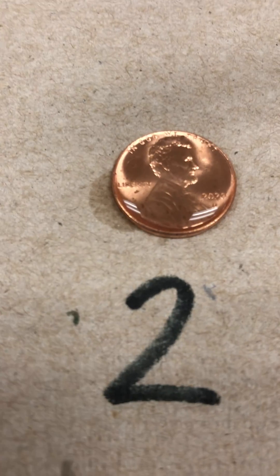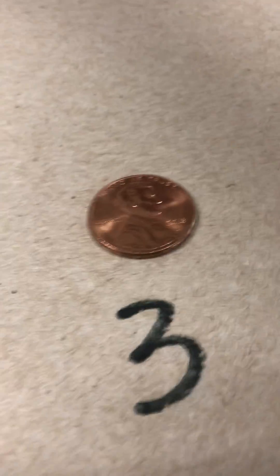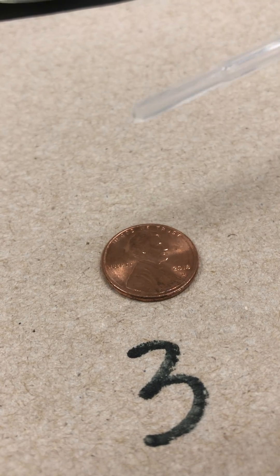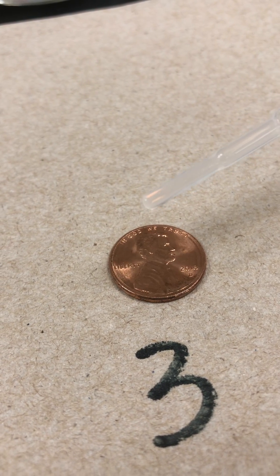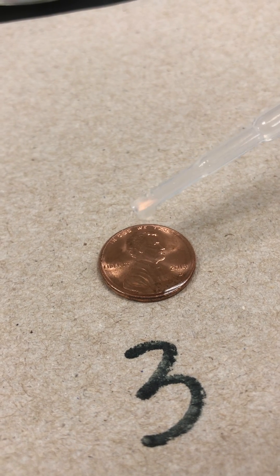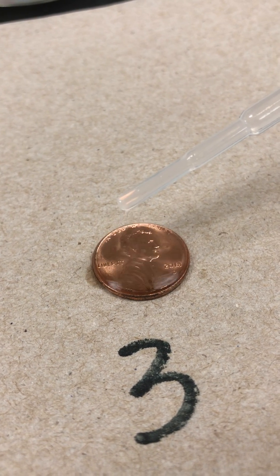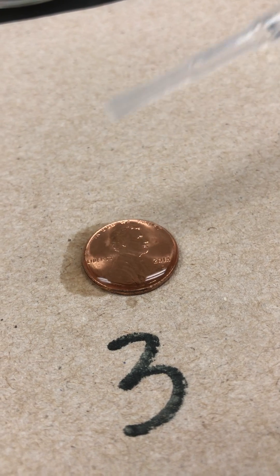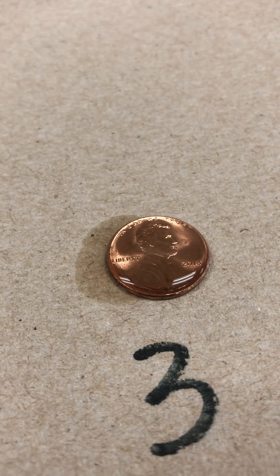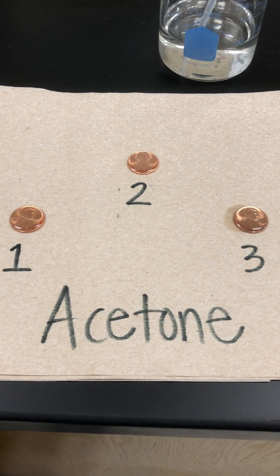And it spilled over there. Okay, so that's done — now get ready for trial number three. And that one's definitely spilled over there. So you can add up those individual numbers and divide by three to get the average of how many drops of acetone can fit on a penny.